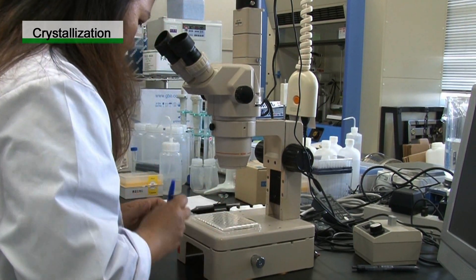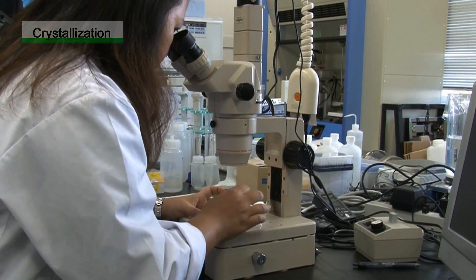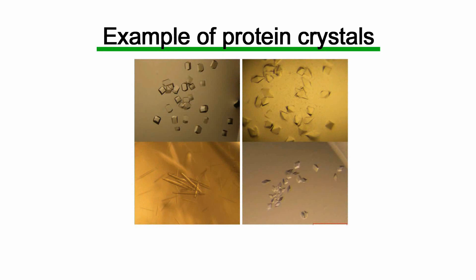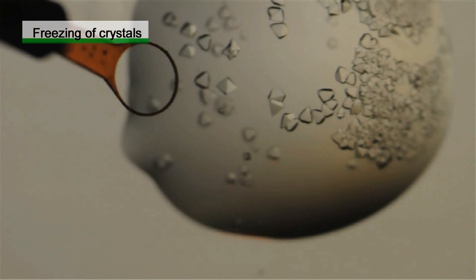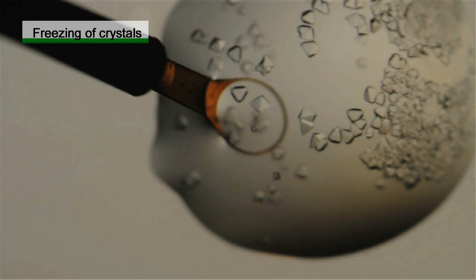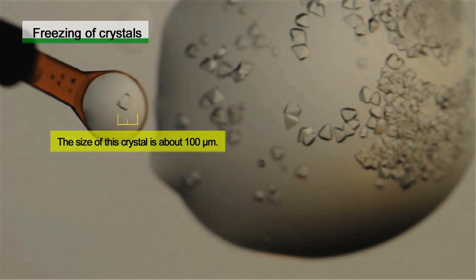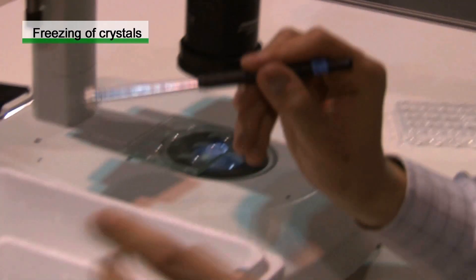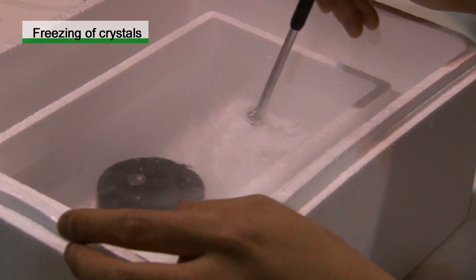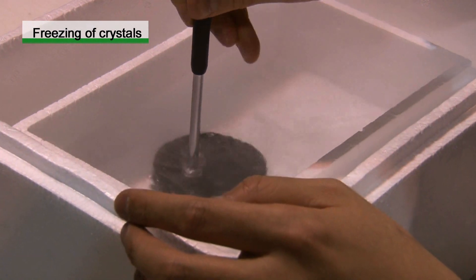Protein crystals are visually inspected under a stereomicroscope. These are examples of well-shaped protein crystals grown in suitable conditions. After crystallization, preparation for a diffraction experiment is necessary. Firstly, a crystal is scooped with a resin loop. Next, the crystal is frozen in liquid nitrogen and packed into a cassette for the automatic sample changer.